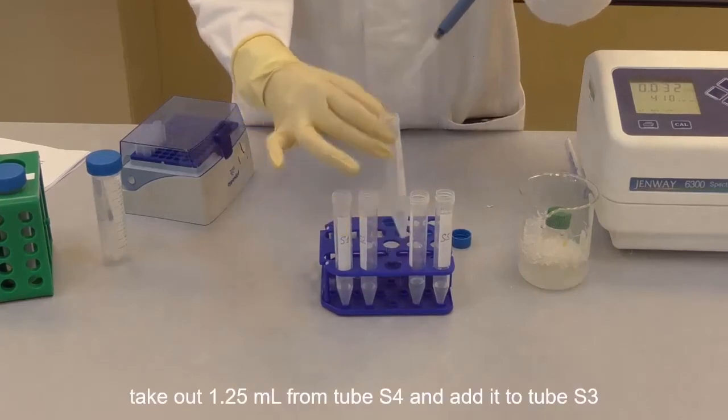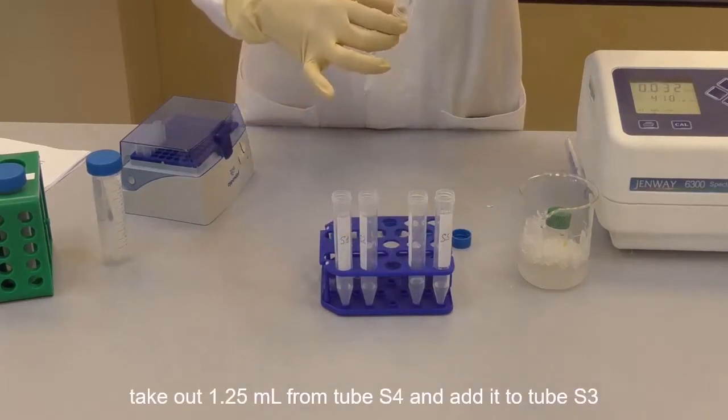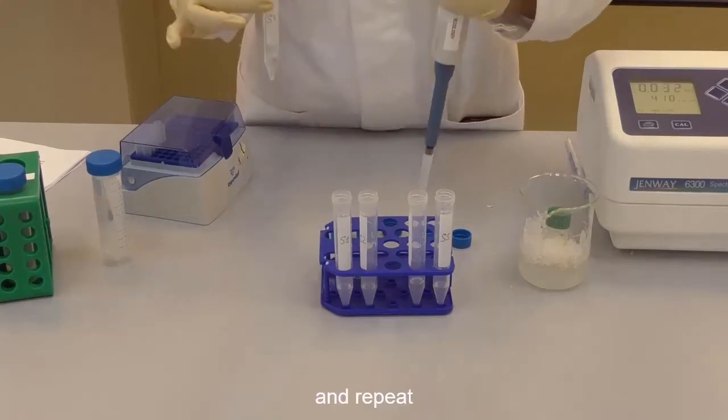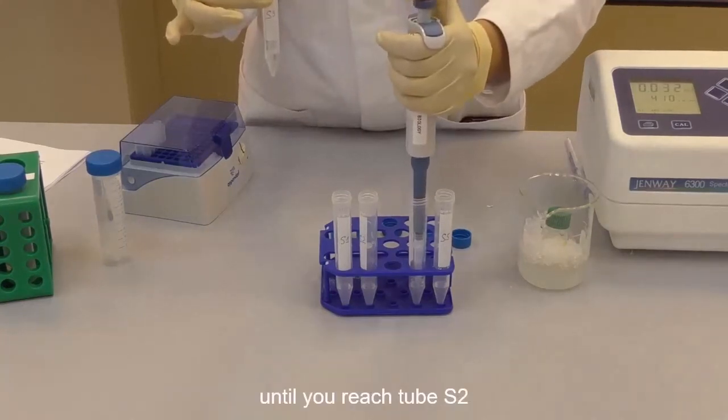Repeat the procedure and take out 1.25 ml from the tube S4 into the S3 tube. Mix it well, and then do the same for the tube S2.